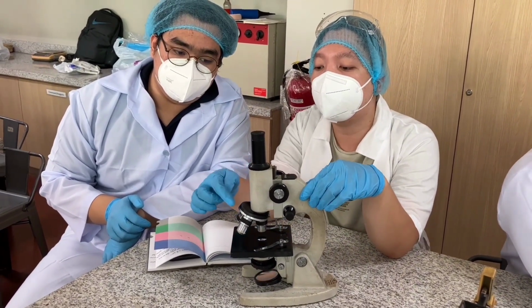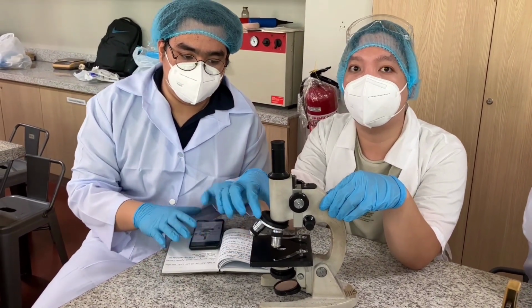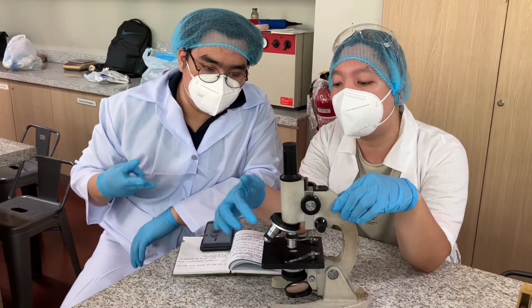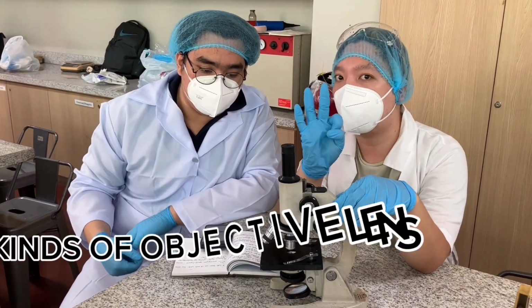Now, we have here what we call this one, the circular one, the turret or revolving nosepiece. Okay, now on the revolving nosepiece we have here our objective lenses, and in our objective lenses we have three kinds of objective lens.